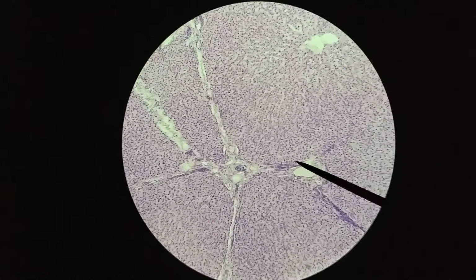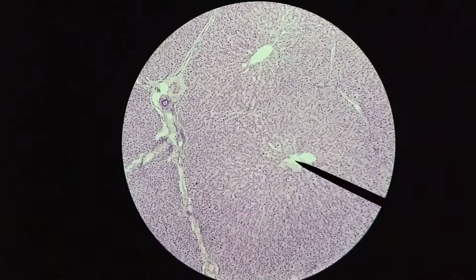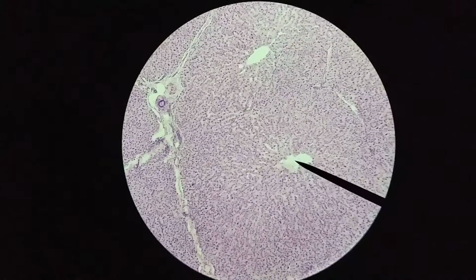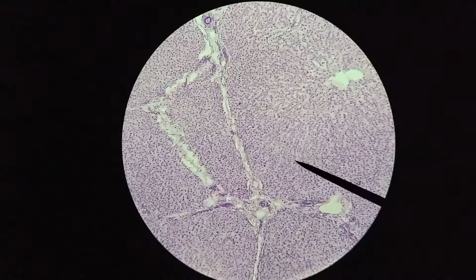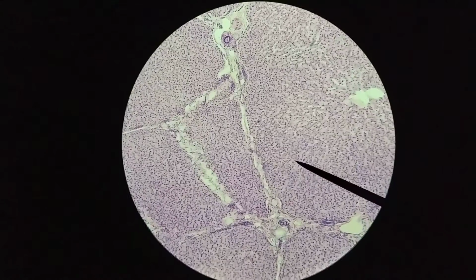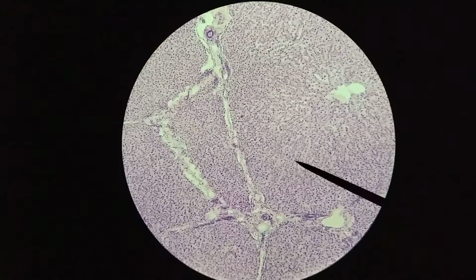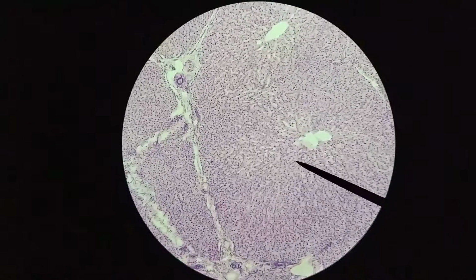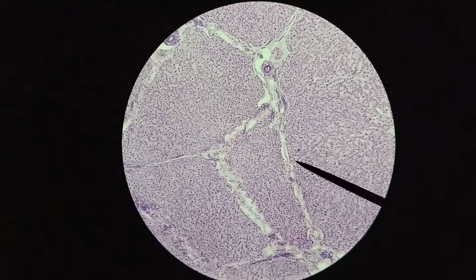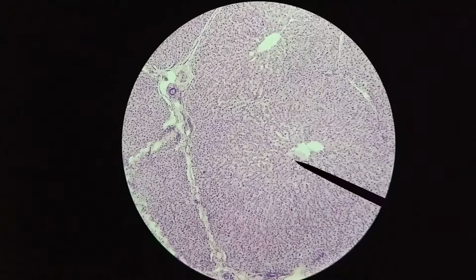What I'd like to point out is that right there is a central vein, and I want you to notice that there's a bit of a radiating appearance to the cells in this area. This is where you find the hepatocytes, arranged into hepatic plates, and they tend to be fairly long chains of cells that are all interconnected. They're basically going from the edge, from where the portal triads are, to the central vein.